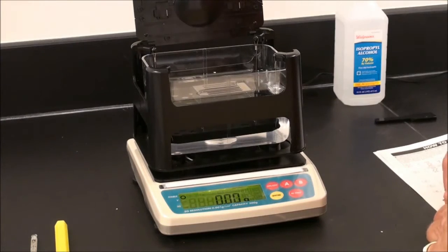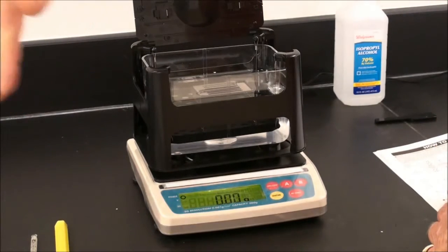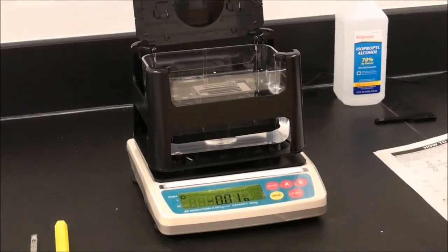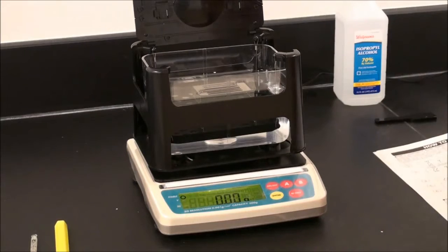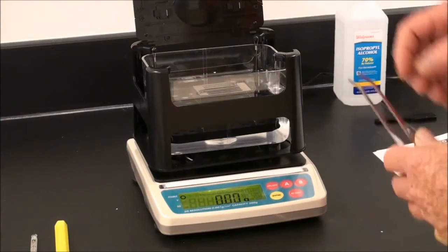In practical operation, the windscreen should be placed around the instrument, as even the motion of air from your hand can offset the balance. It is critical that the table be level, that the balance be level using the mark on the rear of the instrument, and that all air flow is directed away from the instrument.